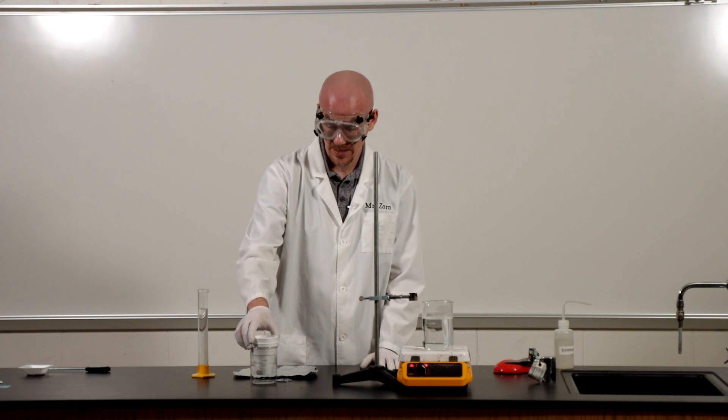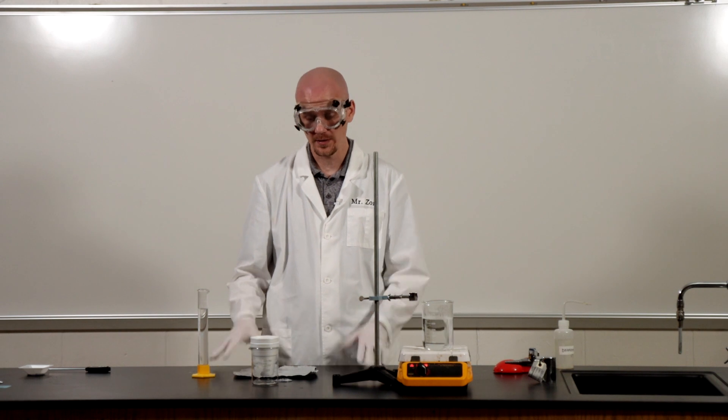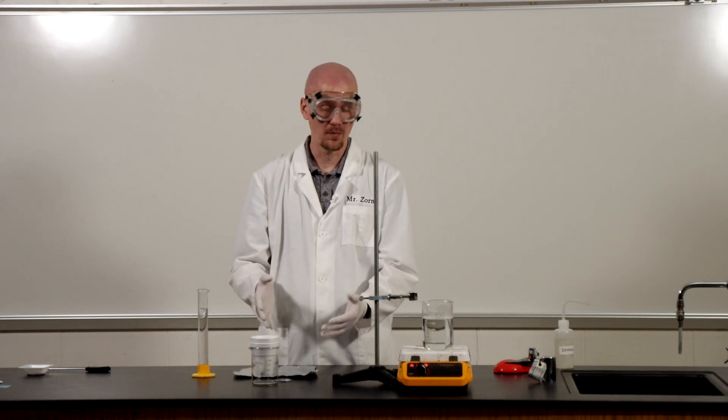All right, so I have two styrofoam cups in a glass beaker here and I'm going to add 100 milliliters of distilled water and I'm going to take the temperature of that water.